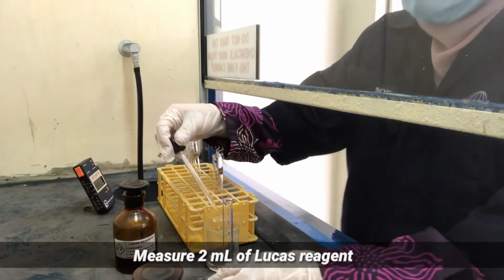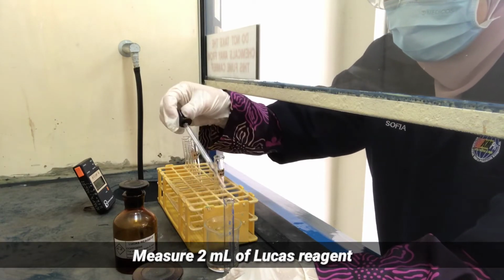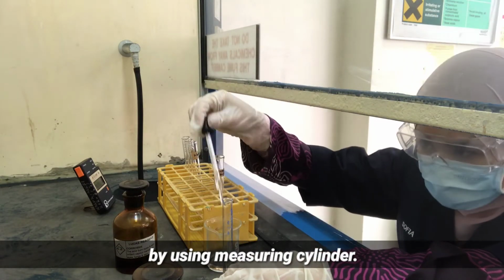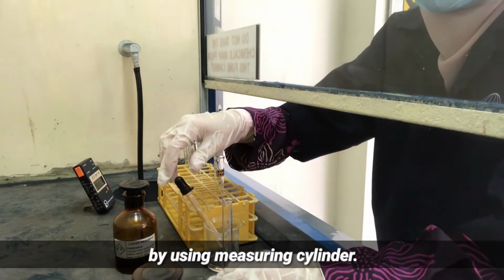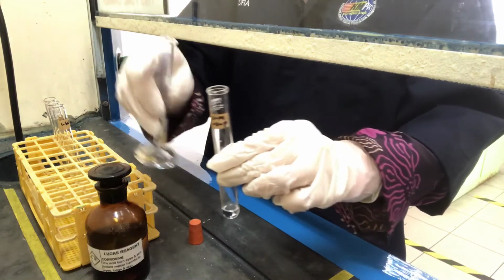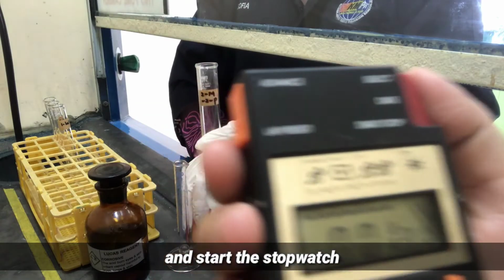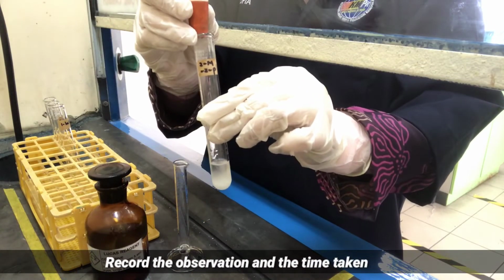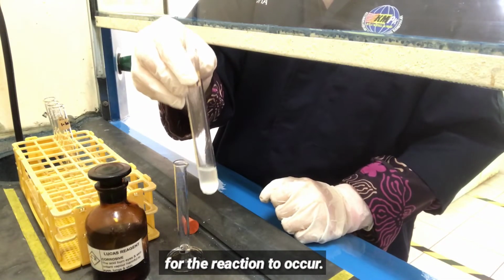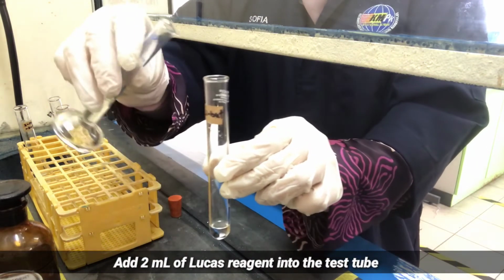Measure 2 ml of Lucas reagent by using a measuring cylinder. And add the Lucas reagent into the test tube containing 2-methyl-2-propanol and start the stopwatch immediately. Record the observation and the time taken for the solution to turn cloudy. Repeat the same steps by using the next alcohol.